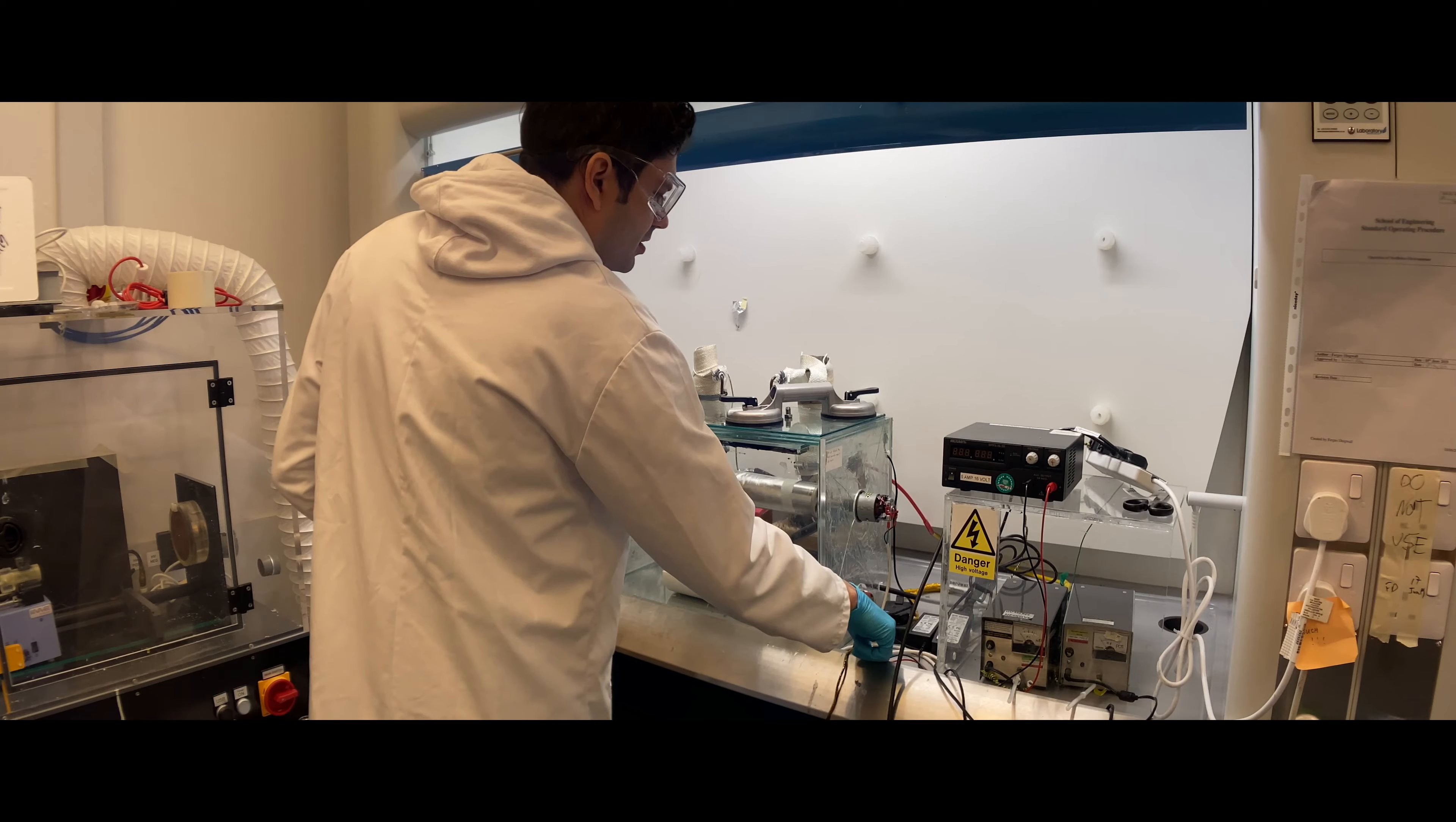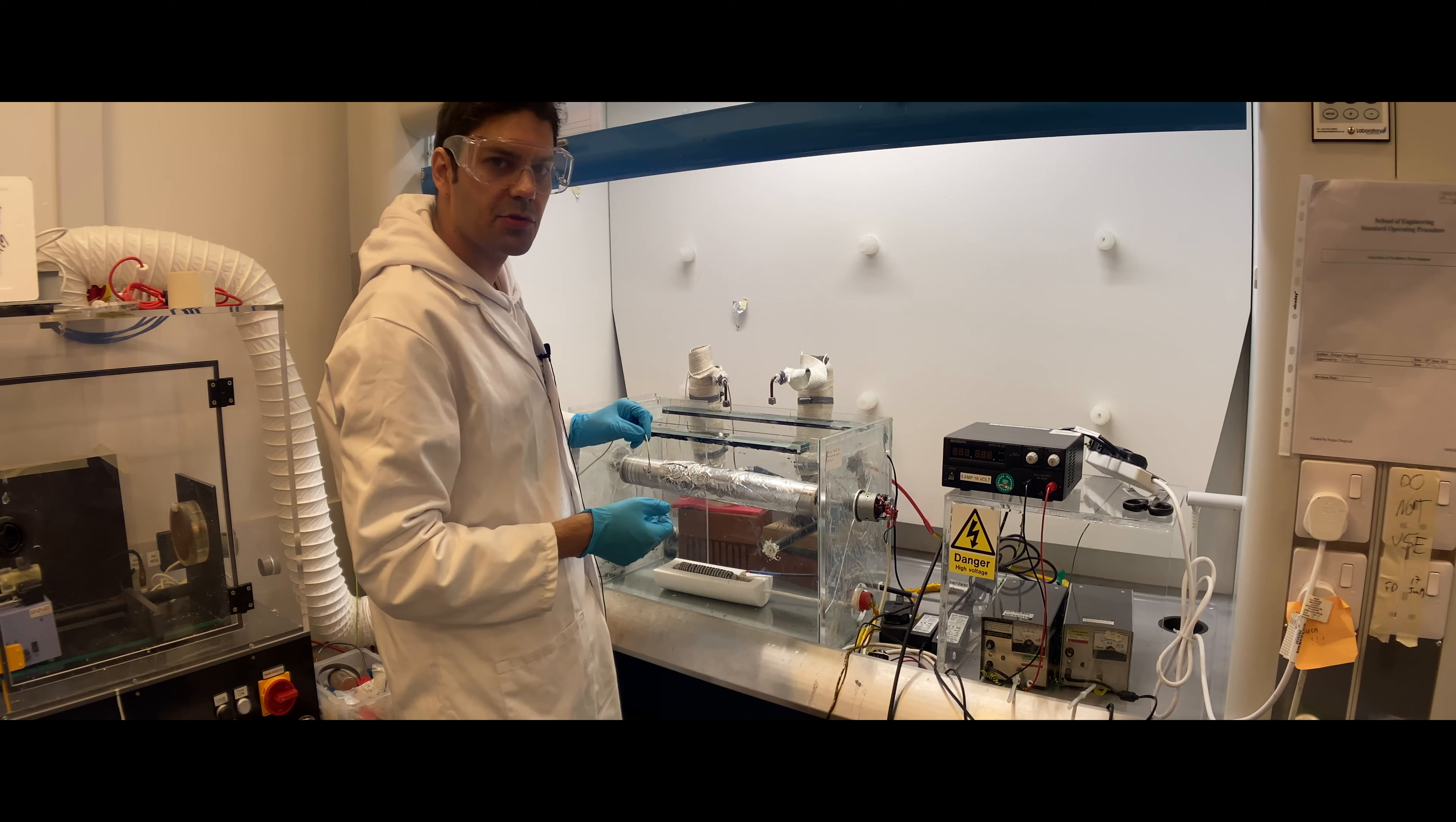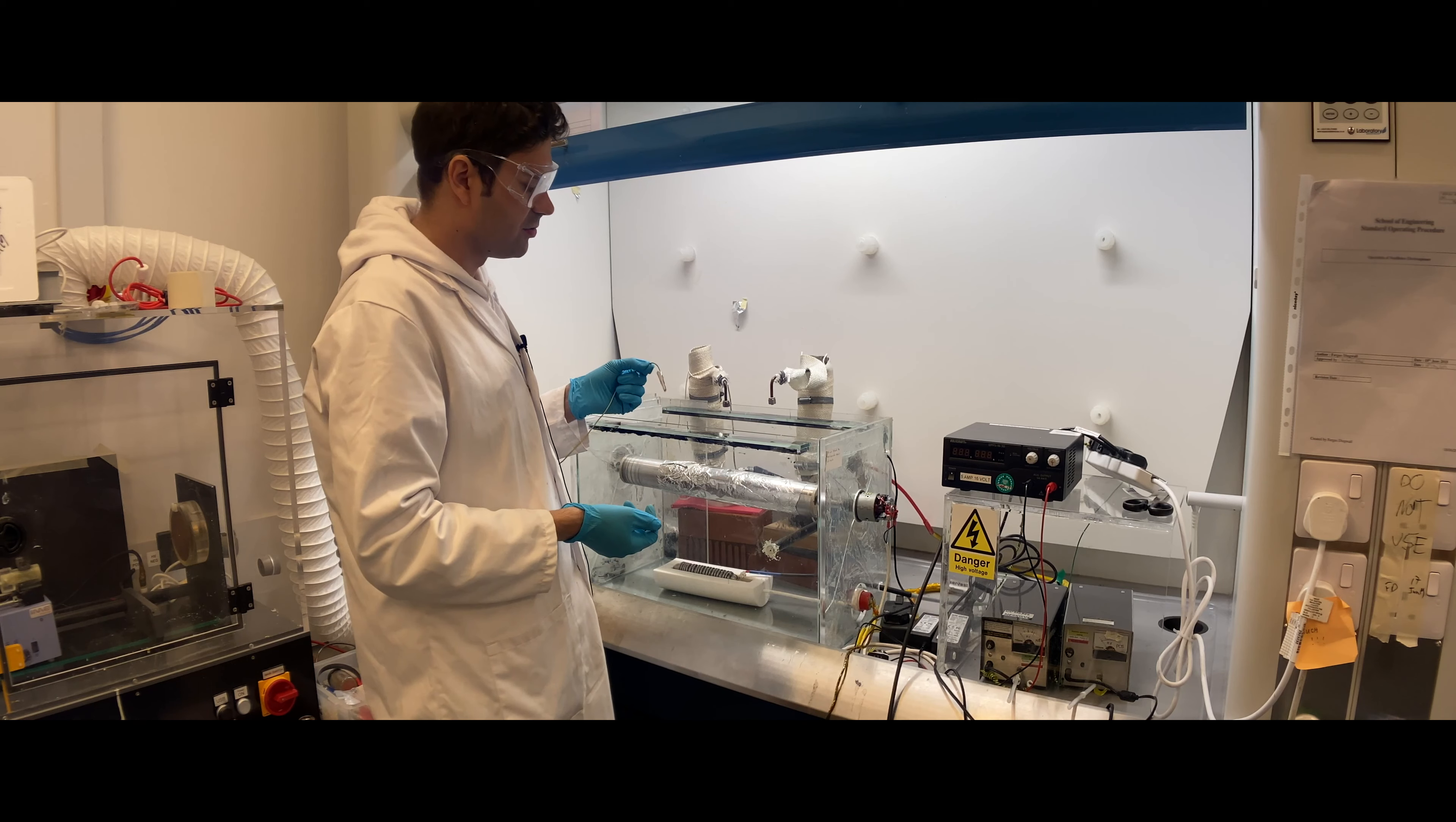It will stop the motors and everything, and then you can open your setup. Very carefully open this lid—if you find it too heavy, you can ask for help. Once you remove the lid, before touching anything, since it might still have some charges that might shock you, you should use a grounded cable to touch both the collector and the high voltage electrodes. You might see some sparks between the ground and the electrodes—don't be scared, it's normal.